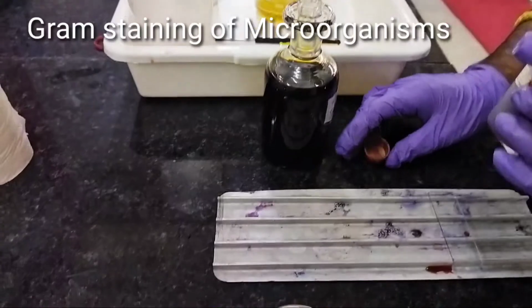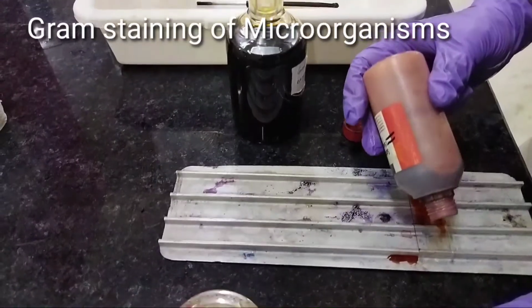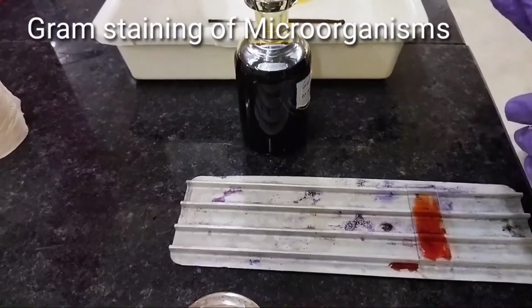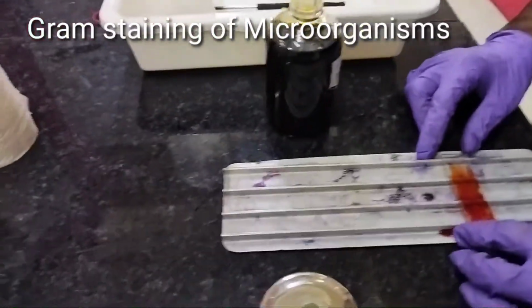Now it's the turn for secondary staining using safranin. We will give safranin on the glass slide drop by drop or fluently like this, and we will allow it to stay for 1 minute.